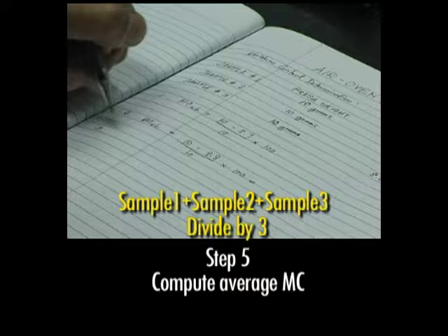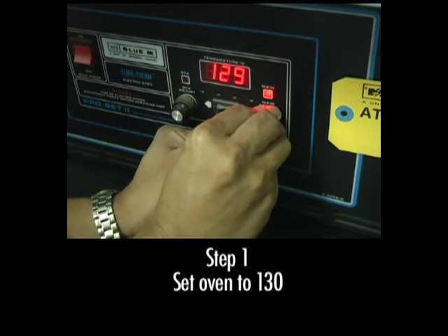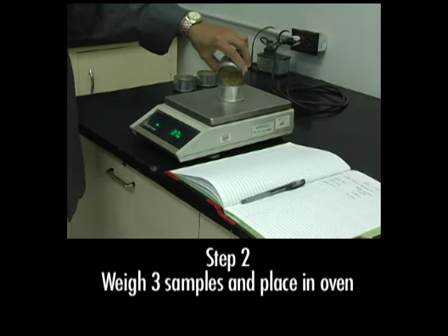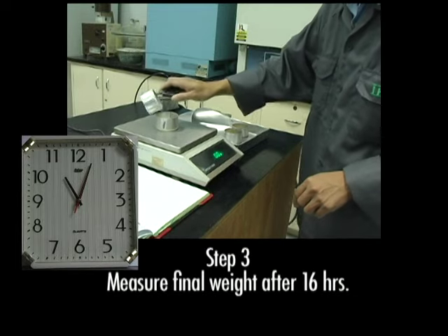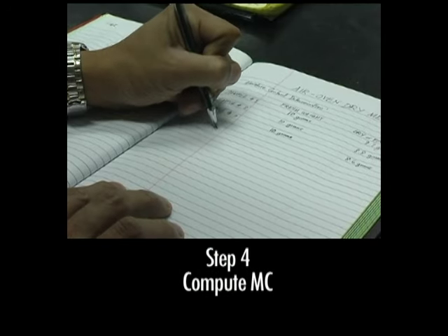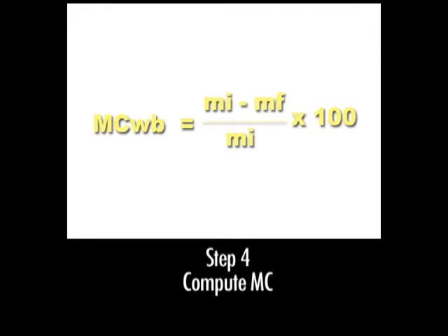Let's review those 5 steps again. Set the oven to 130 degrees, weigh 3 samples of paddy and place them in the oven. Measure the final weight of the samples after 16 hours. Then compute the moisture content wet basis of the samples before computing the average moisture content.